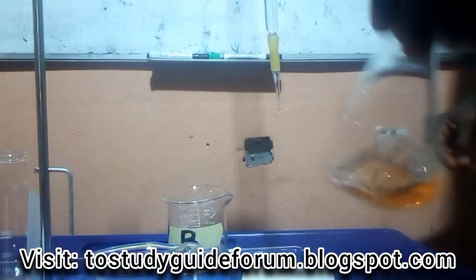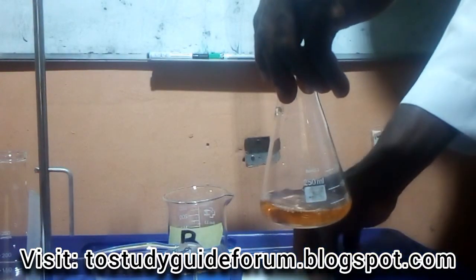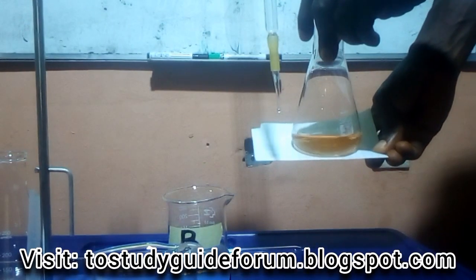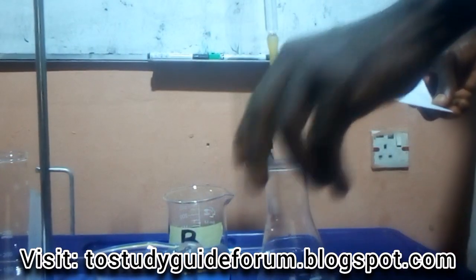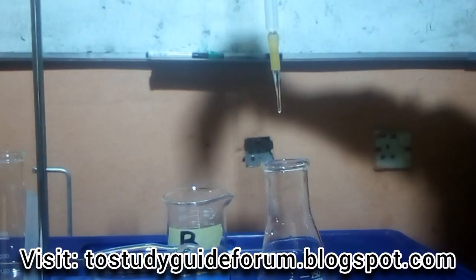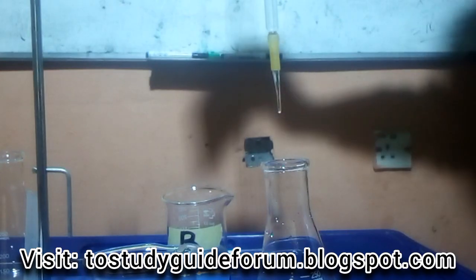Now the color has changed. The color has changed. So let me show you. The color has already changed. As you can see, no more yellow. So the color has changed now. So what's the reading? Our reading now is 12.1. That's 12.1. I think I need to bring the camera closer.